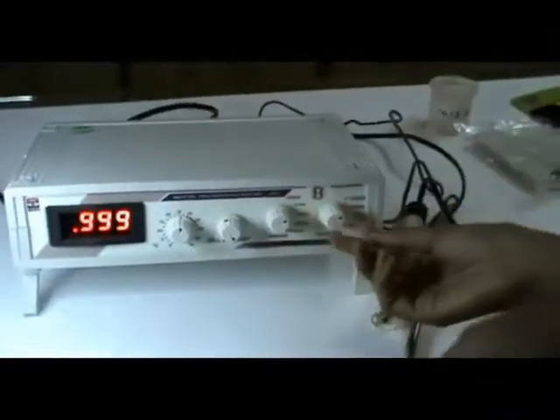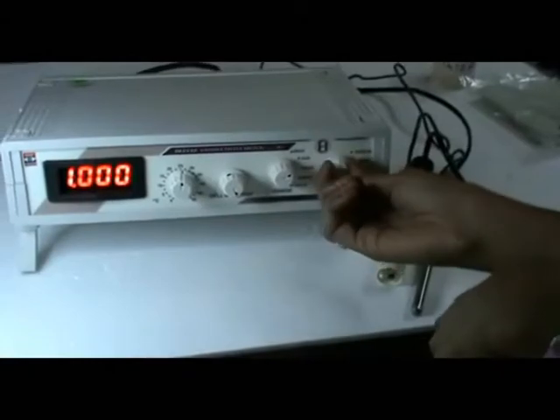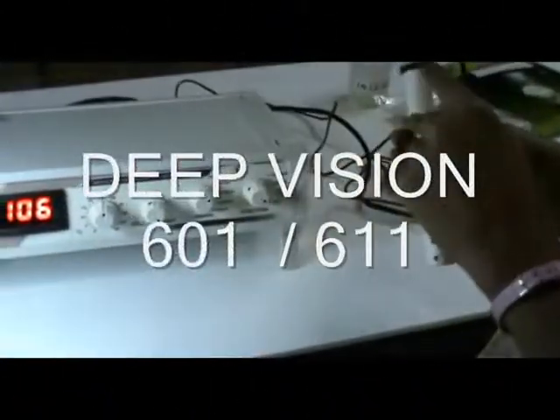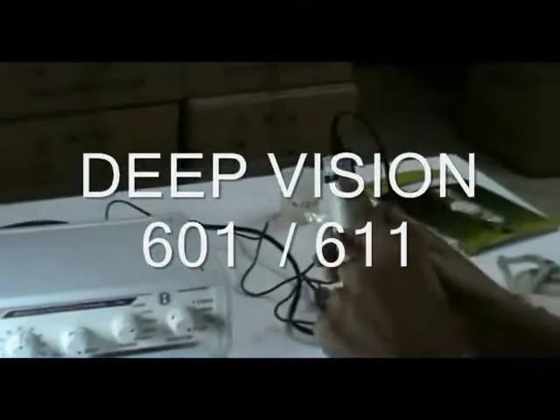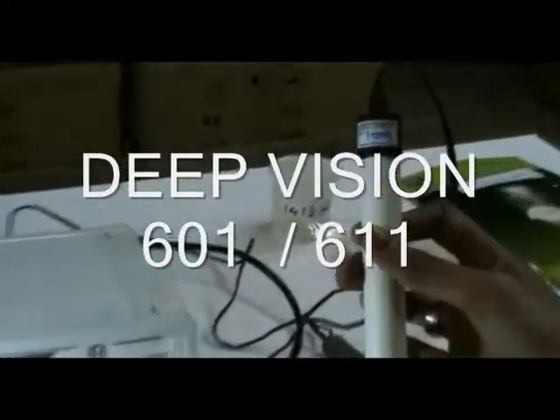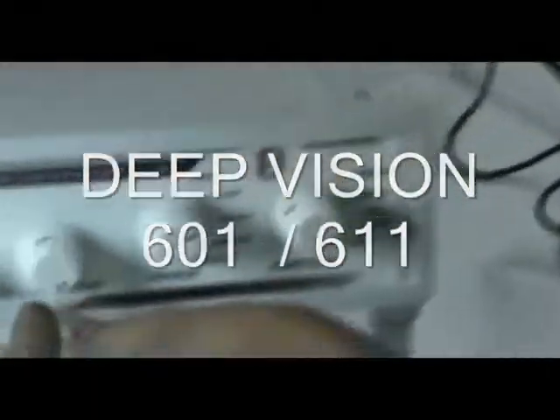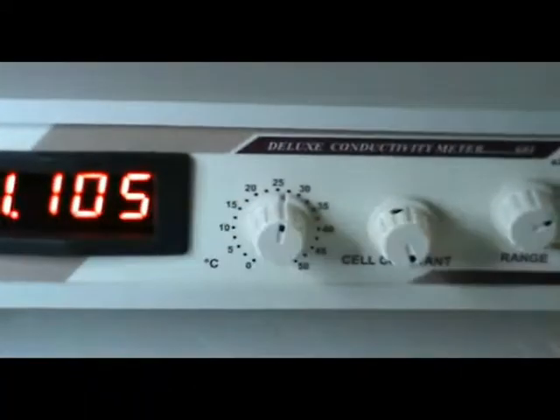Then change the function switch to cell constant position and set the cell constant value. It will be displayed on the top of the cell. By adjusting the cell constant knob, you can set the cell constant value.